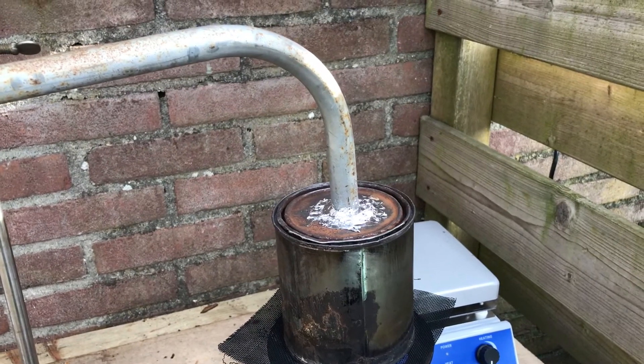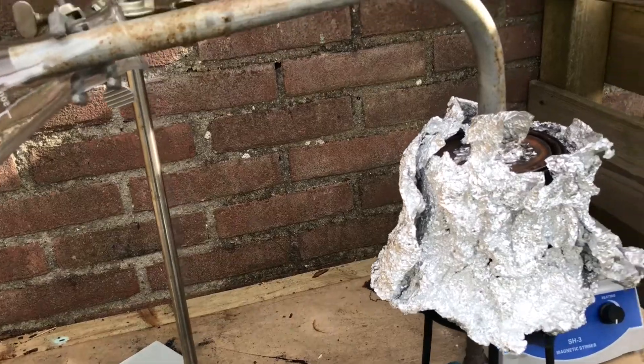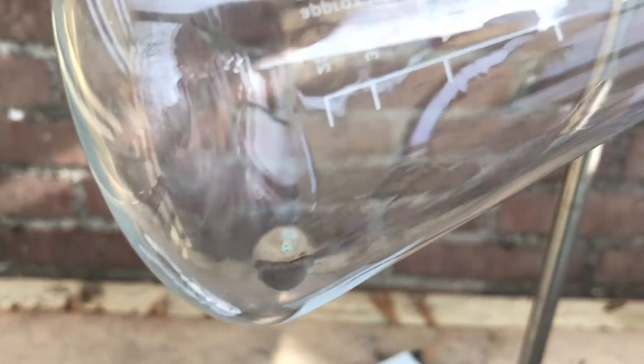It's just a waiting game. Very, very good news — it's working. Maybe it's condensing the acetone. Sweet — literally, because it smells kind of sweet.